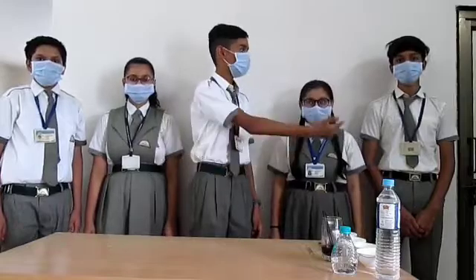Hello everyone, I am Tarun Gela and let me introduce you to my friends: Nandini, Yub, Titi, and Prayers. Today, we the students of Standard 10 from Sri Mathis Hiti Gandhi's medium school are going to perform experiments on acid, base and indicators.